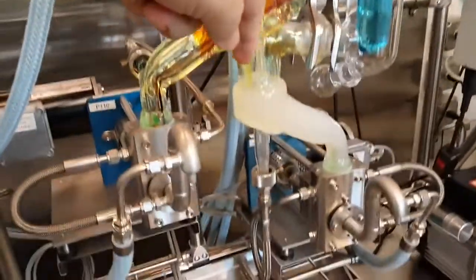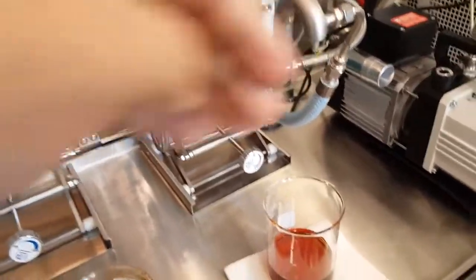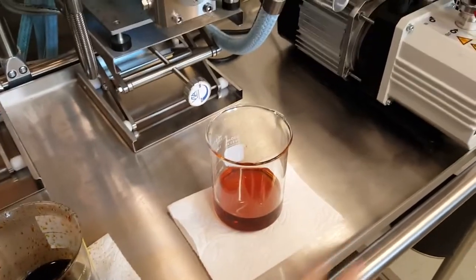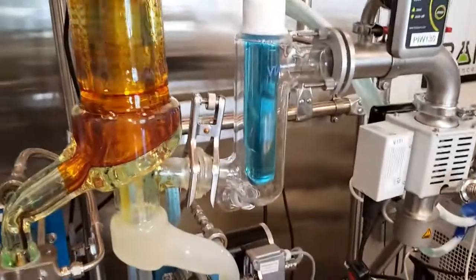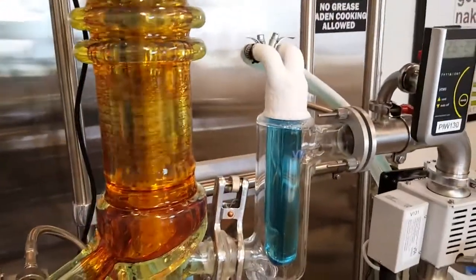It is hot enough to vaporize the goodies, which condense in there and go down and come out here. This is all still jacketed to keep it molten. This is actually the second fraction — not the terp solvent fraction — this is the THC fraction, as people loosely call it.